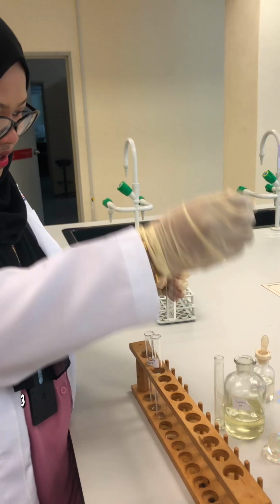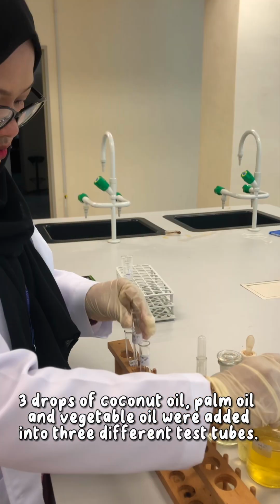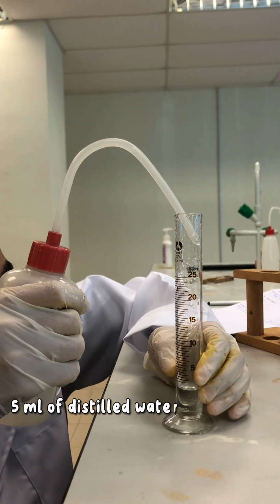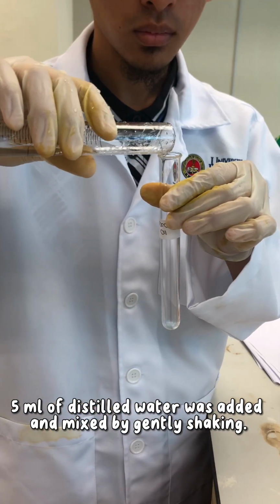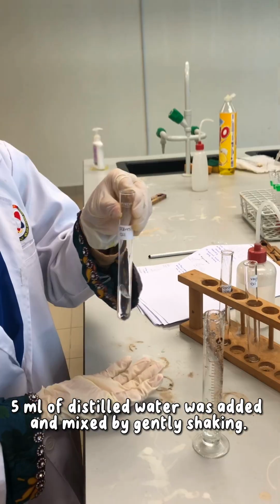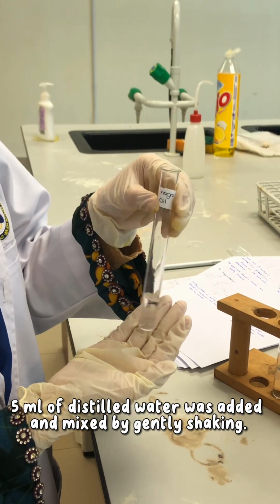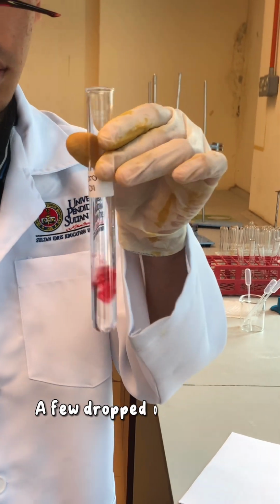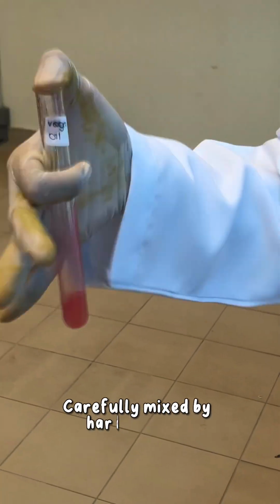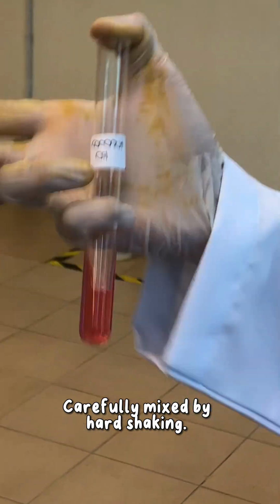Coloring test. First, 3 drops of coconut oil, palm oil and vegetable oil were placed into 3 different test tubes. 5 ml of distilled water was added and mixed by gentle shaking. Lastly, a few drops of Sudan IV were added and carefully mixed by hard shaking. Left them for 1 minute and the result was observed.